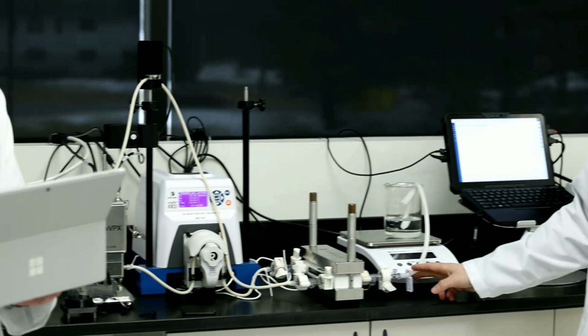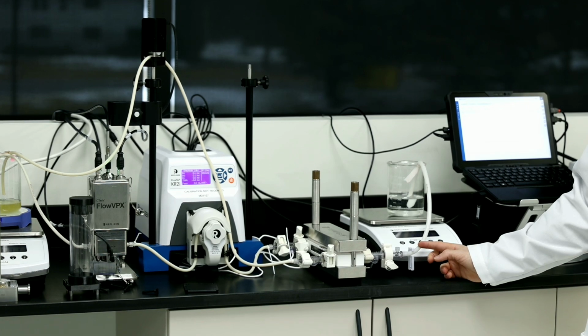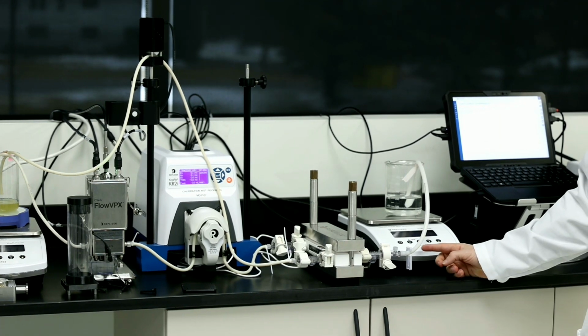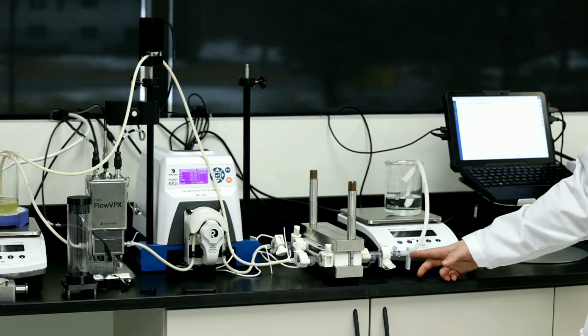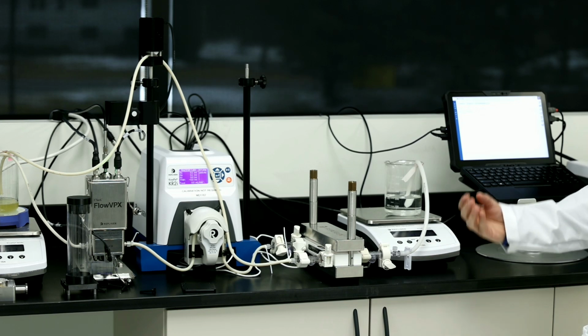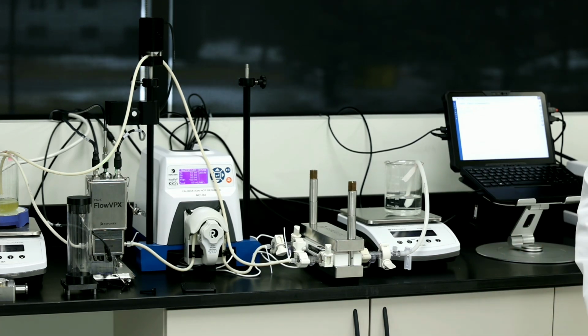However, that's going to measure your concentration on your feed line of the material. If you want to see something like on your permeate line, just seeing if any material is going into the waste bucket, we do have the ability to do a small UV sensor on the side with the conduit so that you can just say yes or no if protein's actually escaping or not. But if you want real concentration measurements up to a very high range, the Flow VPX is going to be a better option.